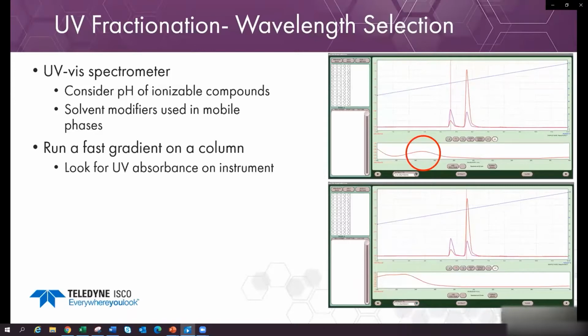For this first peak, I would select this maximum at 260 nanometers to maximize the peak sensitivity, and a wavelength on the shoulder to keep the larger peak on scale. We want smaller peaks larger to maximize compound recovery, while keeping large peaks on scale allows us to verify a single component only is eluting.